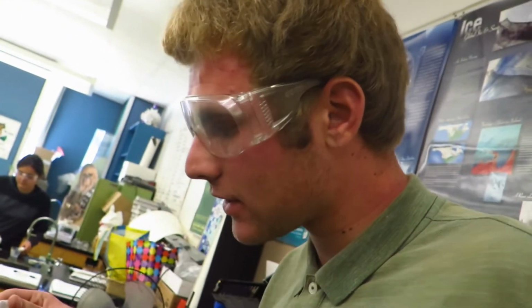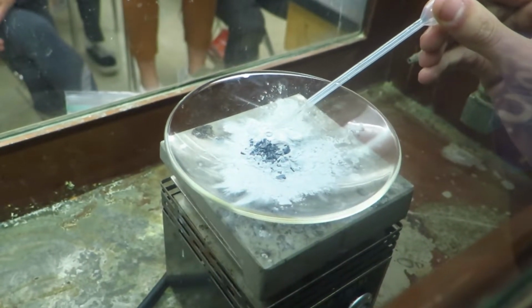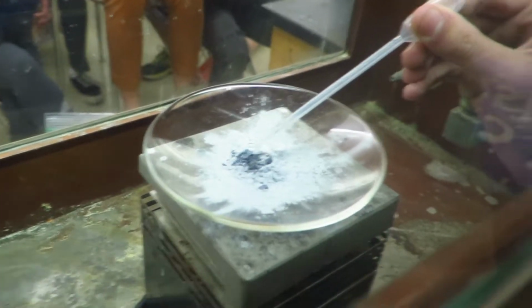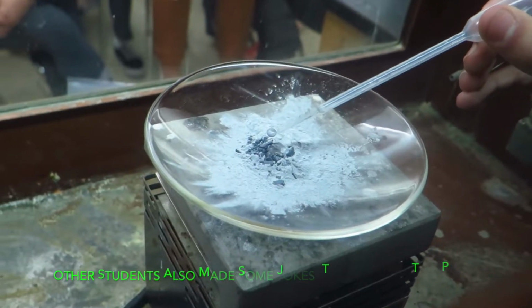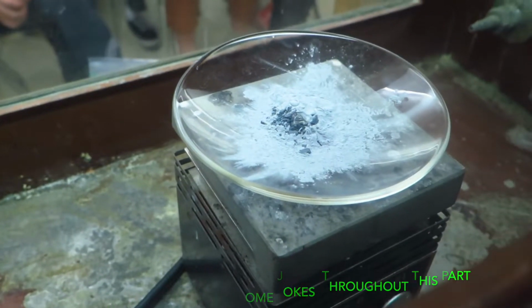I have a little eyedropper here that I'm going to use to put some water on top of this iodine here, and it will dissolve some of the iodine, and it will kickstart the reaction. And just for those of you who may be confused, the iodine is the black solid and the aluminum powder is the gray powder that is on the dish. It might take a few minutes, just so everyone knows.